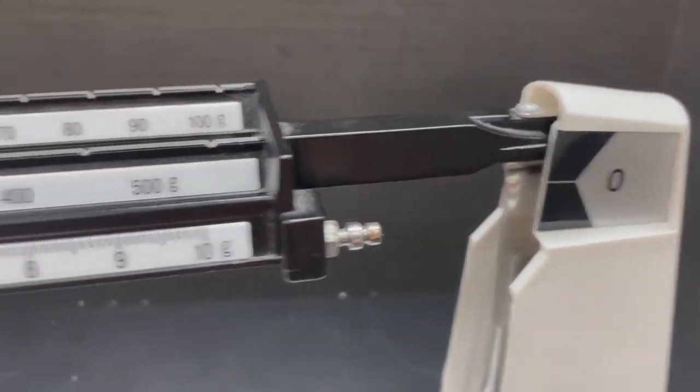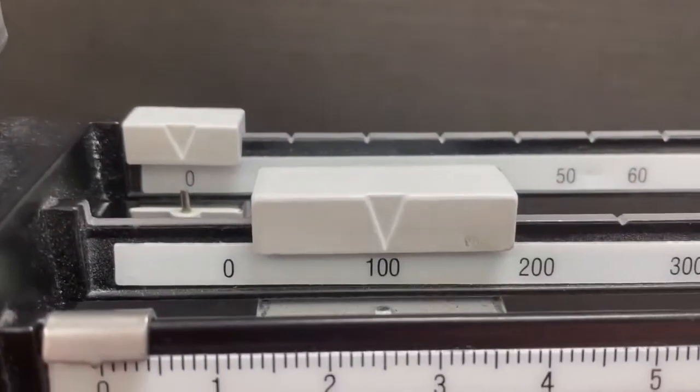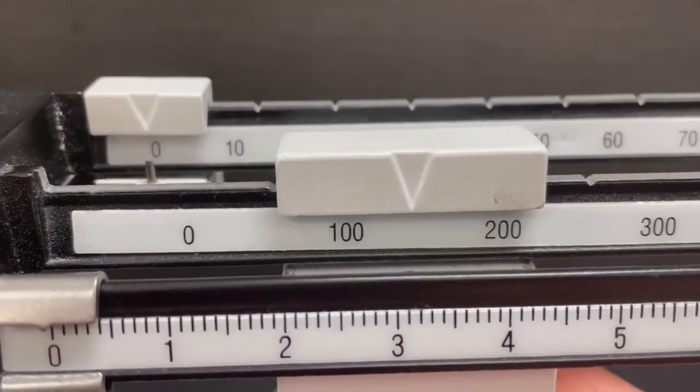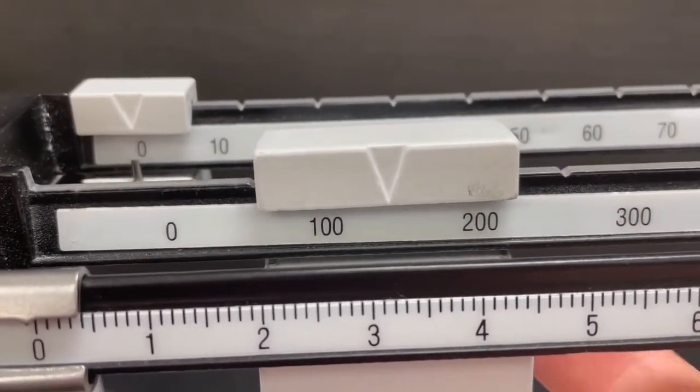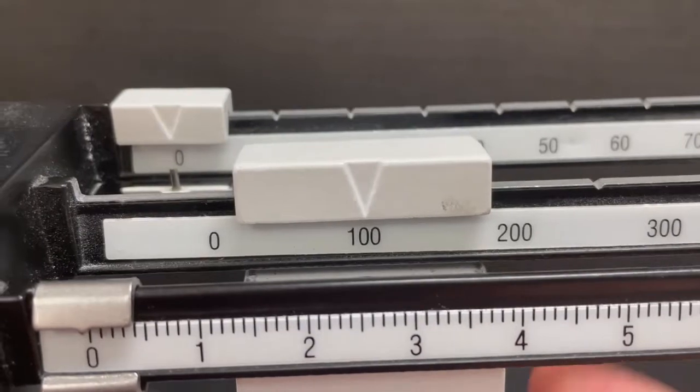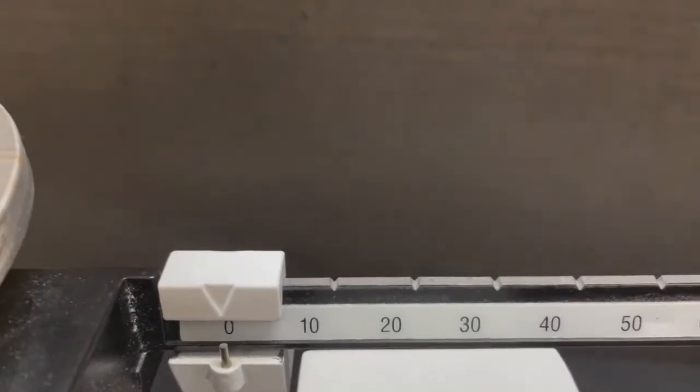That's not enough weight, so we need to add some weight. We can't go and put this in between because it's not pointing at a number. You leave that at the 100, and then we go to the 10 gram weight.